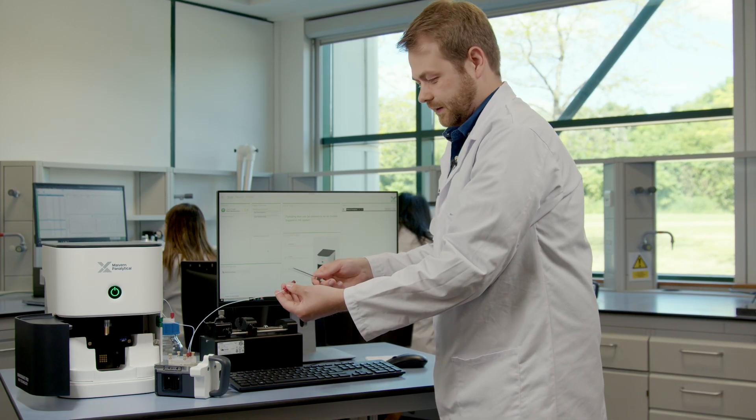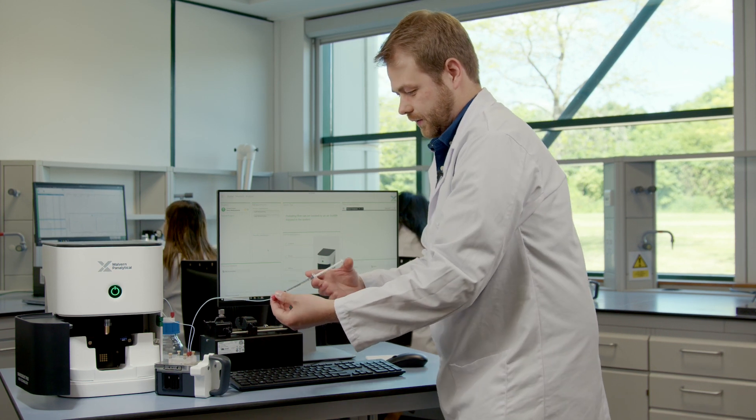We do this using a syringe. This sample we've got today is some exosomes that have come from urine so we're just going to load these in slowly.